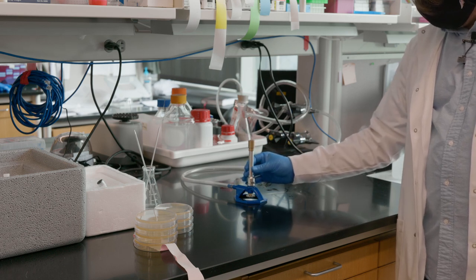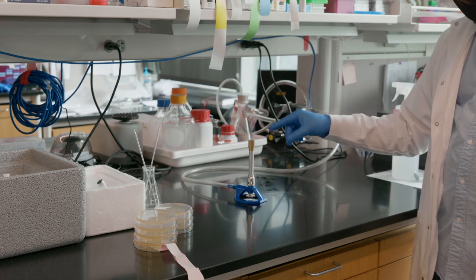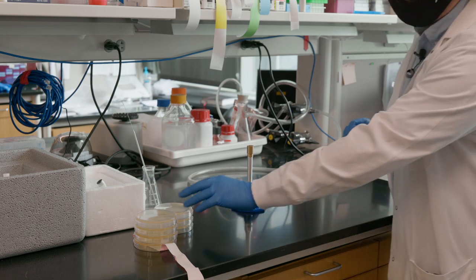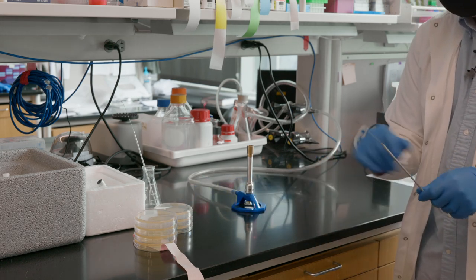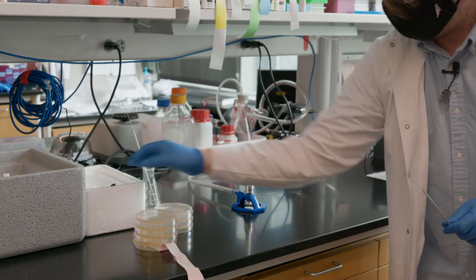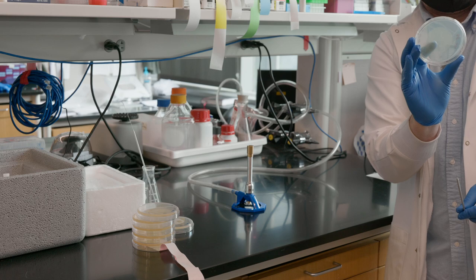By opening this up more, you introduce more oxygen. This is exactly what we want: a light blue cone inside of a darker blue flame. The procedure is pretty easy. We want to put the bacteria that are in this agar stab onto this agar plate.